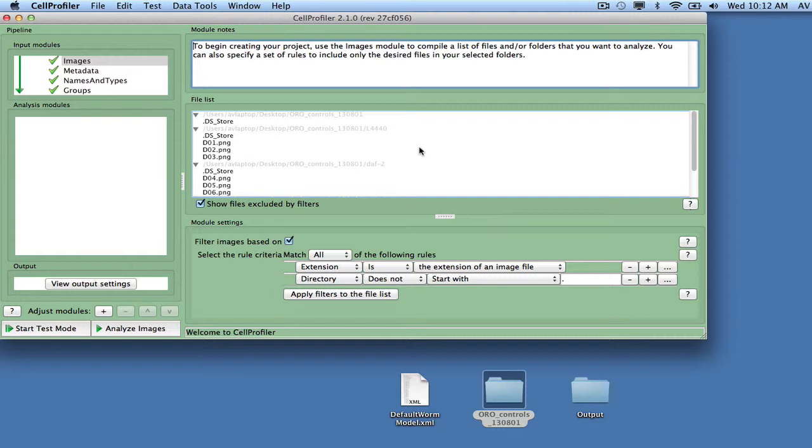For the current dataset, select 3 images from each gene. For example, you can use all the images from wells in row D of the plate. The input module metadata enables extraction of metadata from file names and folders. In this case, we aren't making any measurements and can therefore omit metadata extraction.